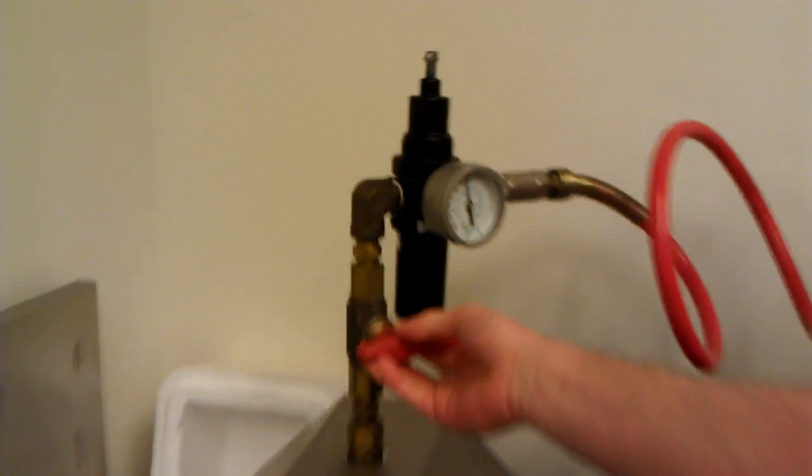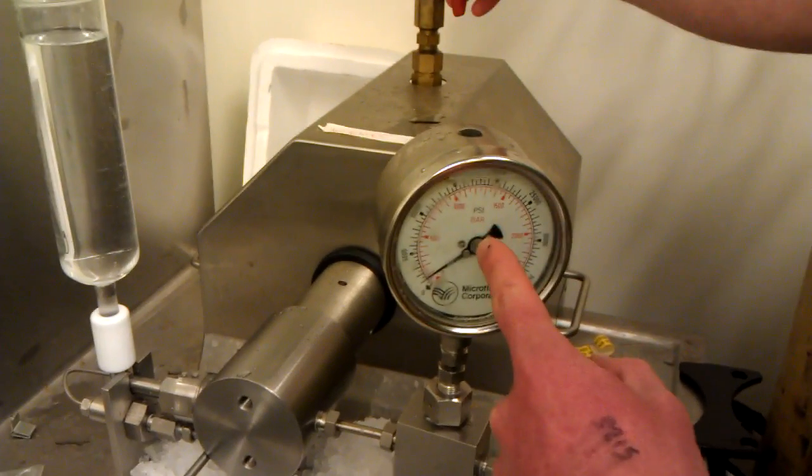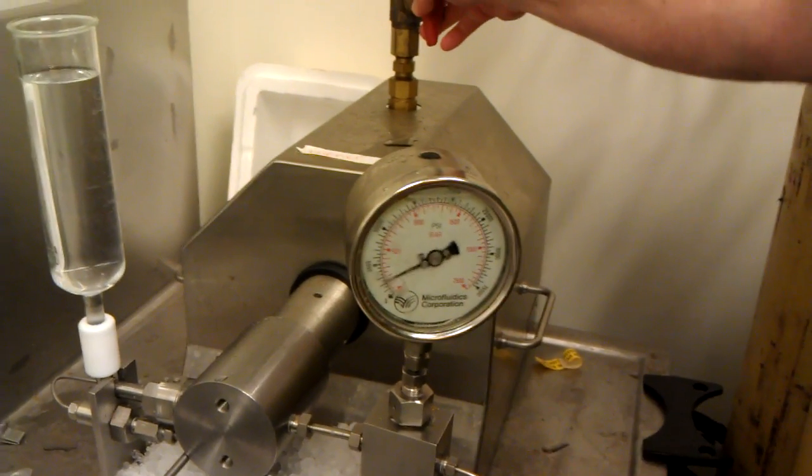You turn the instrument on here and you will read the pressure out with this gauge down here. It makes a loud noise.